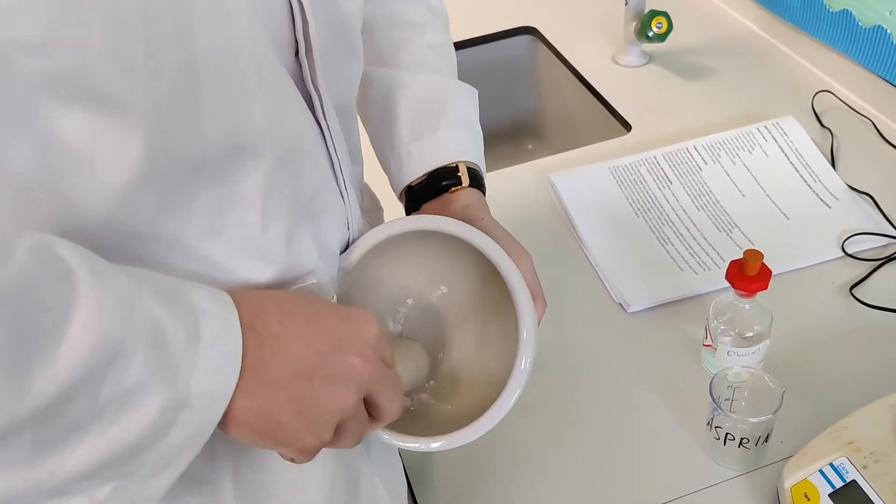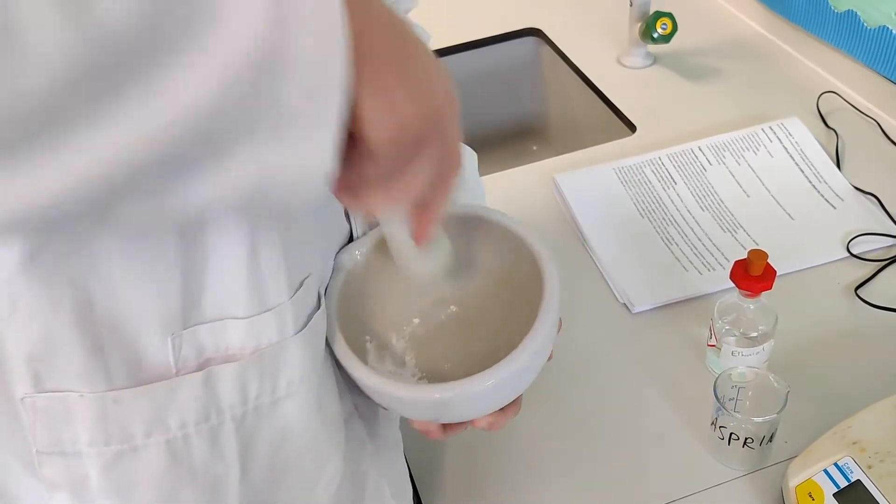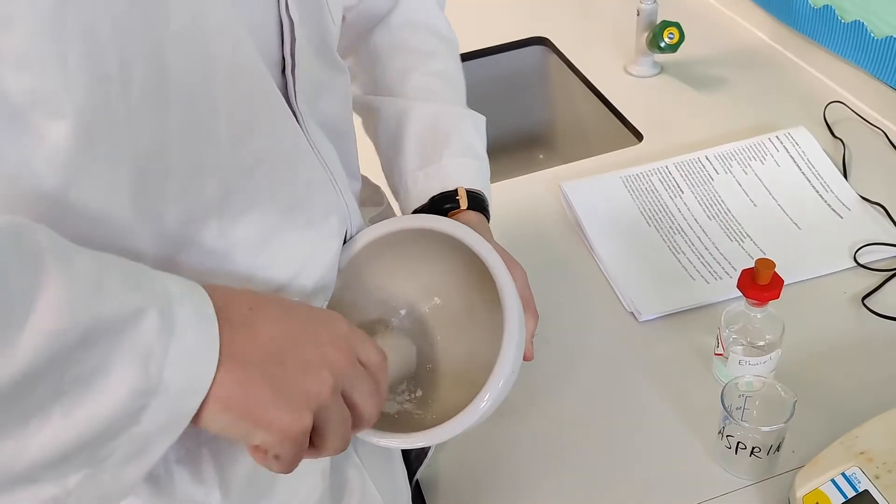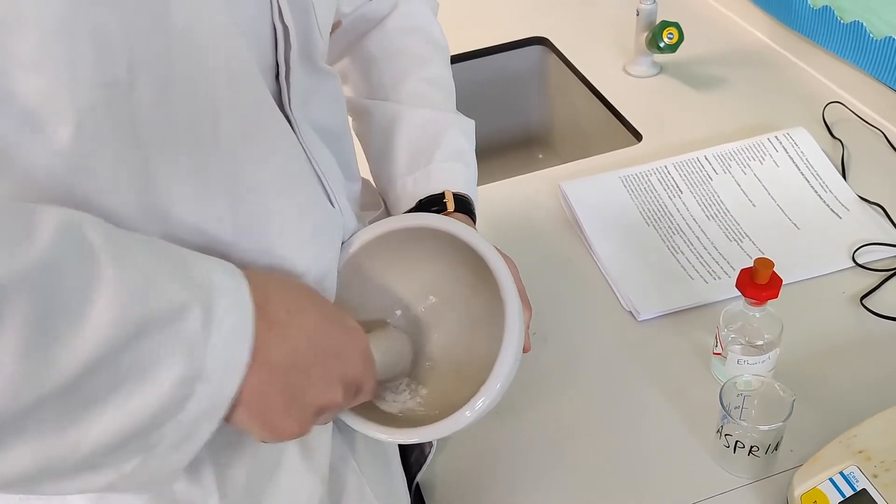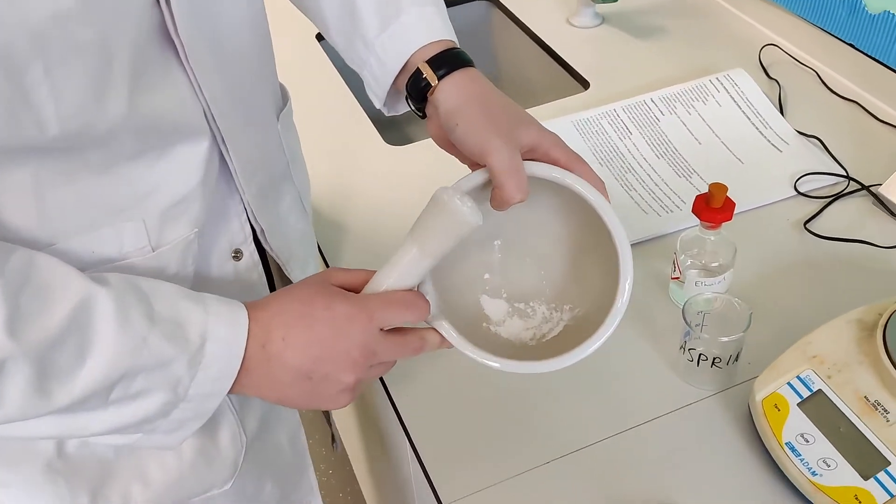And we eventually will get a nice fine powder. It's very important, don't just bang like this. That's not going to do anything. You need to grind against the mortar. There we go. So we've got a nice fine powder. It didn't take that long.